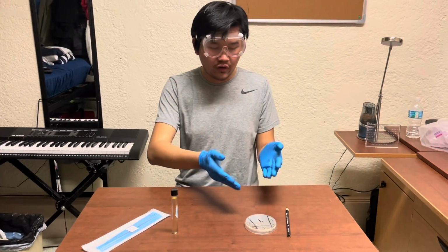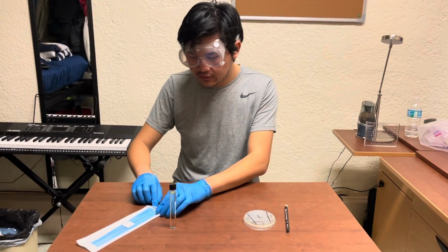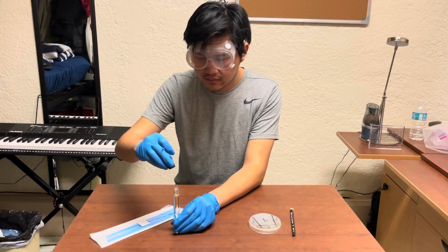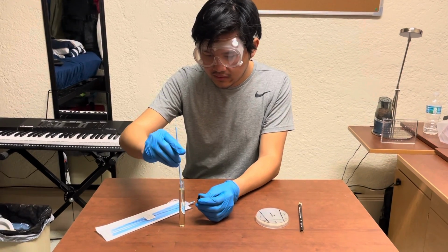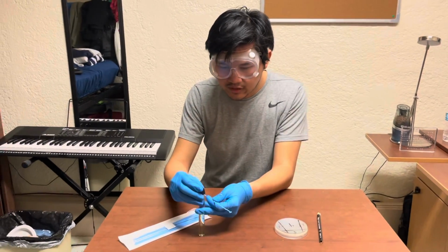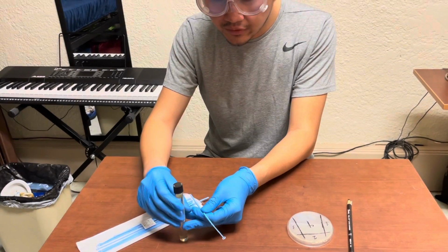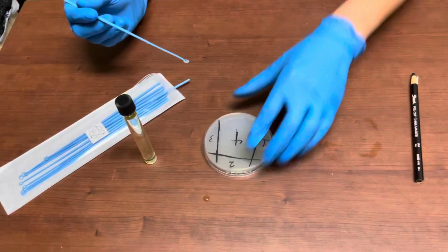So now that we have our agar plate marked and we have our plastic inoculation loops and our media, the first thing I'm going to want to do is take one sterile plastic inoculation loop. I'm going to open the media. I'm going to dip the inoculation loop in the media, making sure it got covered. It has a reasonable amount of media on the inoculation loop. You'll notice because it looks like a bubble wand, and you'll see, oh hey, if this were a bubble wand, I'd be able to blow a bubble through it. Don't actually blow bubbles through it. This is bacteria.